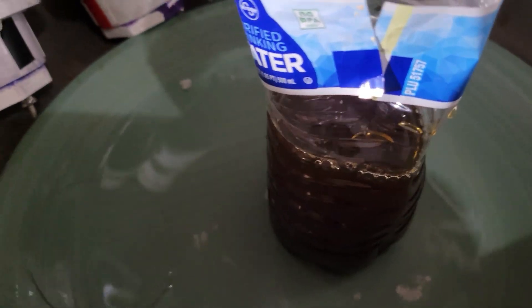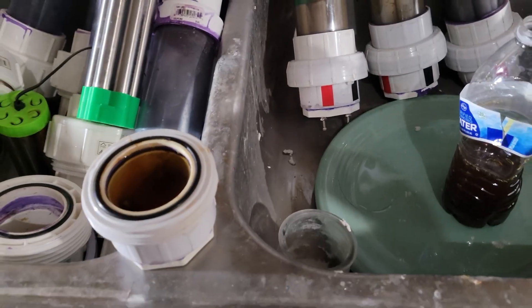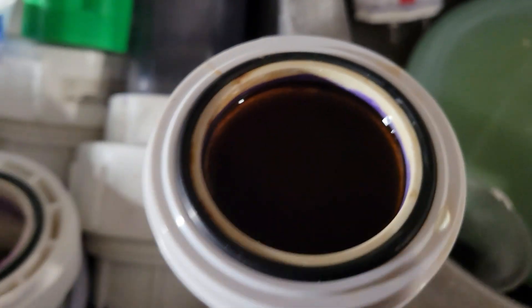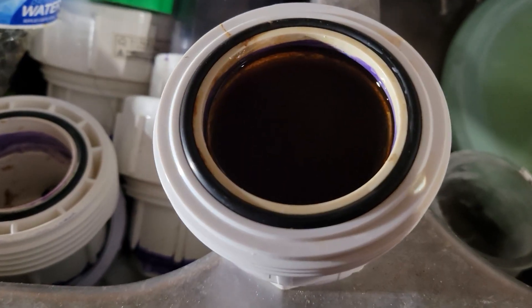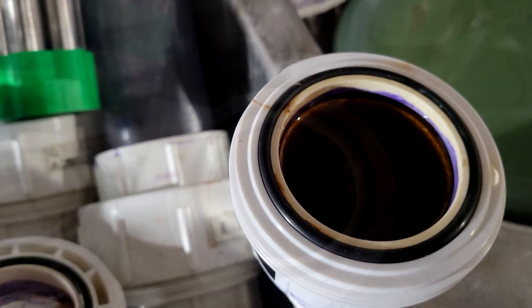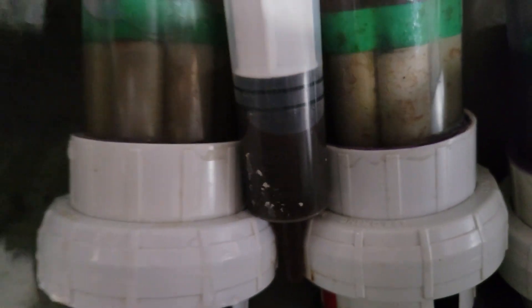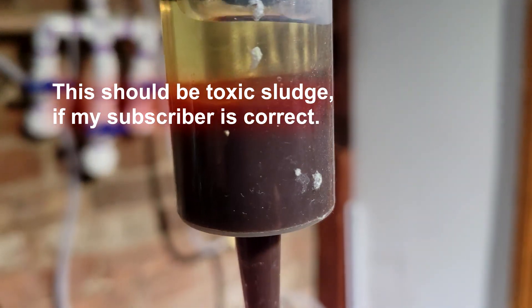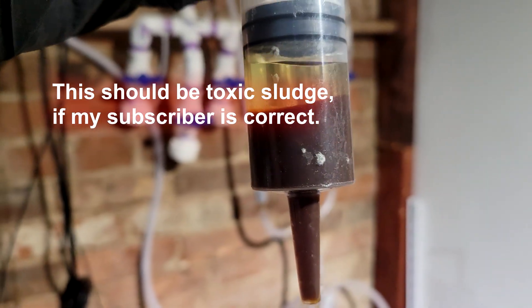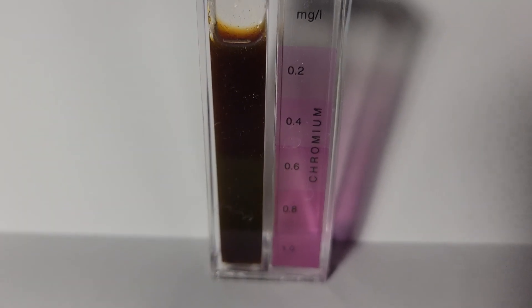I've got more poured in there. We're going to see if it settles, if I can skim it off, or see how concentrated I can get that mix. I have essentially distilled and concentrated into this container. I'm going to let it distill just one more time and then extract the components. We've got some real good sludge at the bottom. Now we've got the super-concentrate loaded in the syringe. Here we have just a pile of sludge from these cells — a vial of sludge. This will be a solid test.